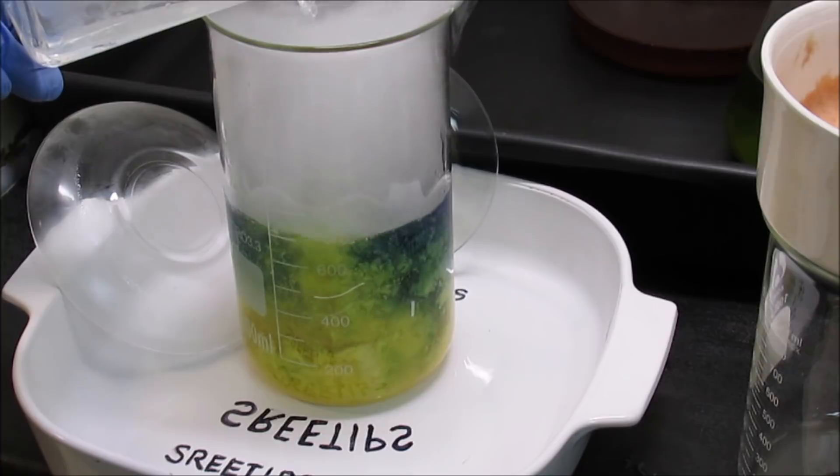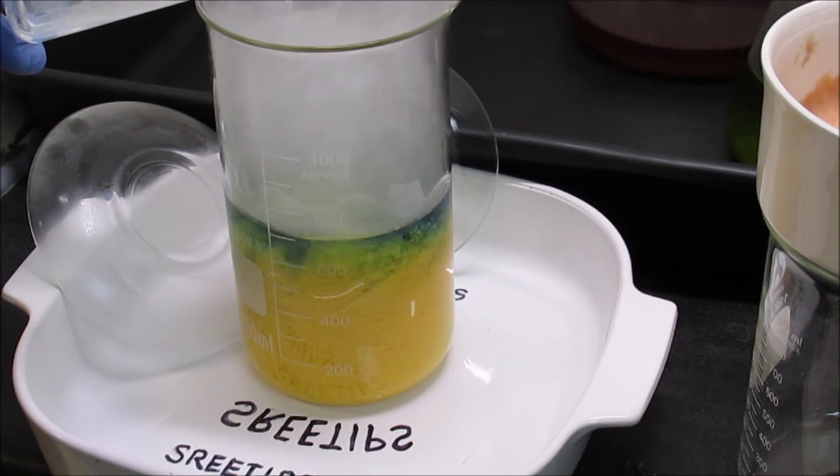Look at that. I'll never get tired of watching this happen. It's just absolutely beautiful. That's our pure palladium salt there.